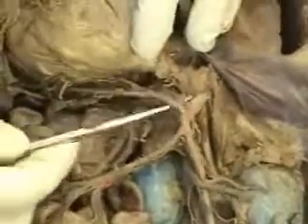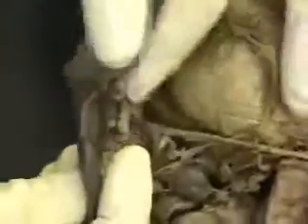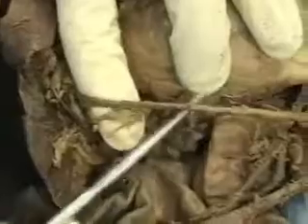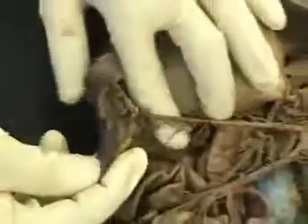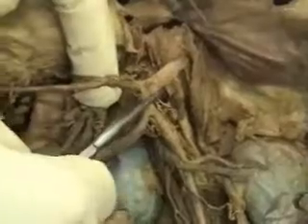This first one, this huge one right here, coming right off near the beginning of the abdominal aorta, is the celiac artery. There are two significant smaller arteries branching off the celiac. A gastric artery supplying this stomach, and this happens to be an especially large stomach, and the splenic artery supplying the spleen right here, the spleen of the cat. Now, in many cats, there's more than one splenic artery, but clearly we name the arteries based on which organ they are associated with. Splenic artery associated with the spleen, gastric artery associated with the stomach, both coming off the celiac artery, which was the first branch off the abdominal aorta.